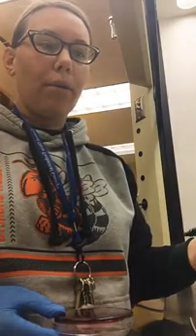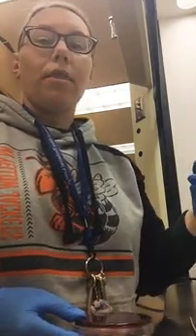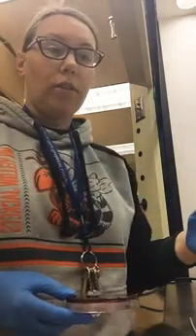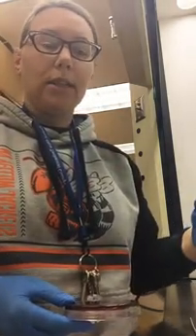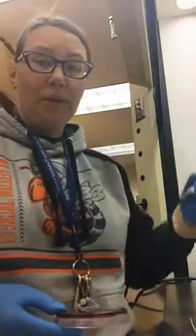The beta and the alpha both are types of hemolysis where the blood cell is consumed, it's lysed, and the difference is between a partial, which is what they call the alpha, and a complete, which is the beta. So when you look at those two types on your dish, you're going to see the red cleared out of the agar, so you'll have growth plus a clearing. With the beta hemolysis, the complete hemolysis, there'll be a section around the growth that looks like regular agar with no red around it. And the alpha, the partial, because it only partially lyses, the red kind of leaks into the agar. So it's like you have red mixed with that pale beige of the regular agar color, and you get a greenish hue around the growth.